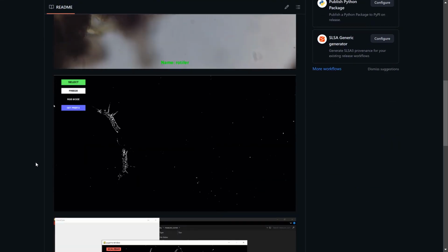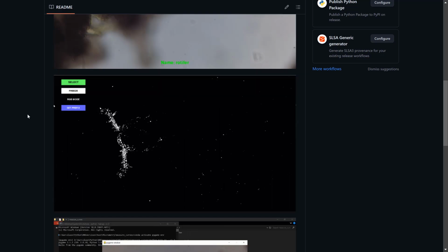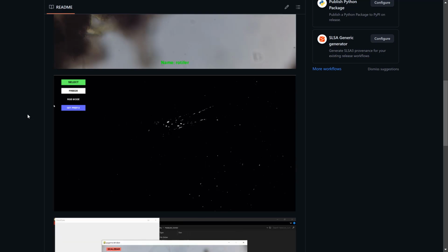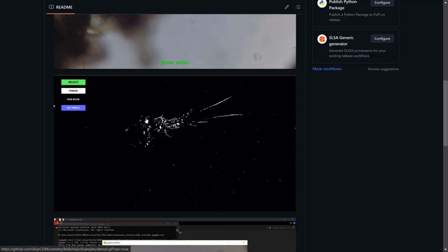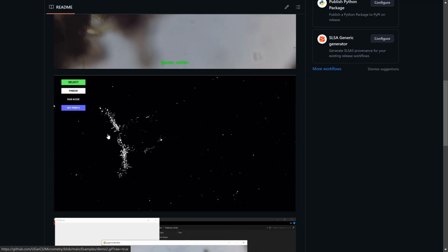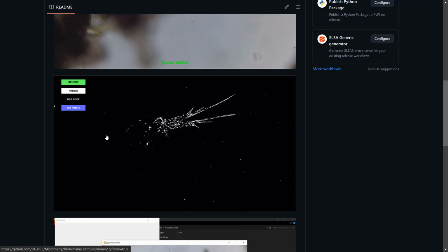Before we continue, I also want to highlight the use of the submodule in Python called OpenCV. OpenCV is a very powerful library in Python that allows us to implement some algorithms in object detection. And here we can see one of them. This is a form of motion detection algorithm, and the effect of slicing through the copepod that we see here in live view is given by the ups and downs in the z-axis of our stereoscope, of our microscope. So it is a powerful tool.